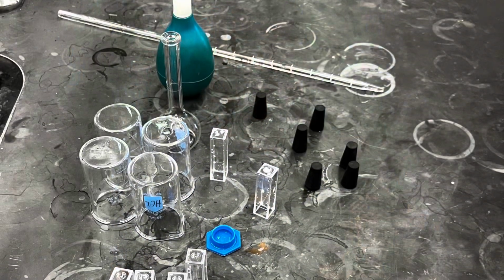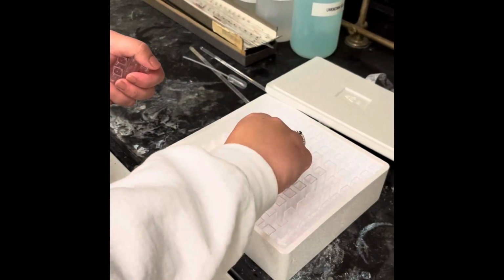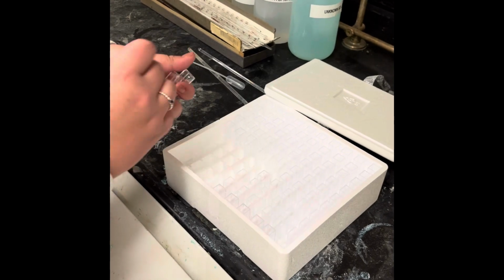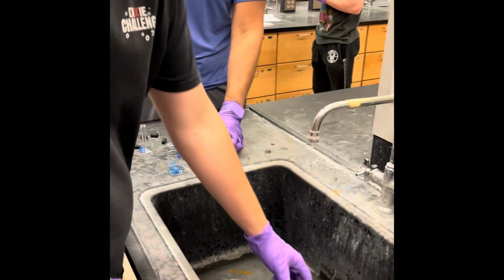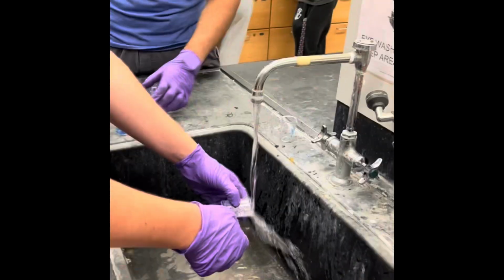Secondly, in chemical reactions, the lambda max of a compound can change as the reaction progresses. To monitor and understand these changes, it's crucial to scan across all wavelengths. By doing so, we can track the variations in absorbance throughout the reaction, enabling real-time monitoring of the reaction's progress.